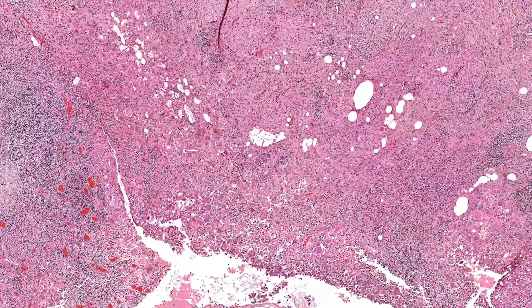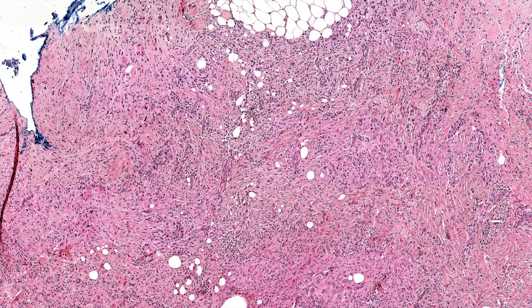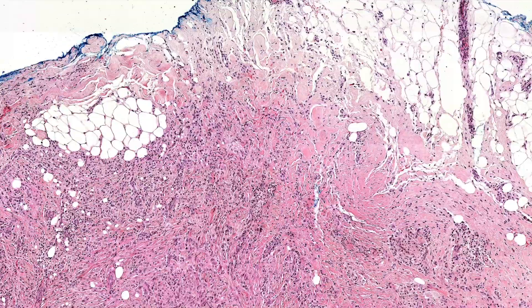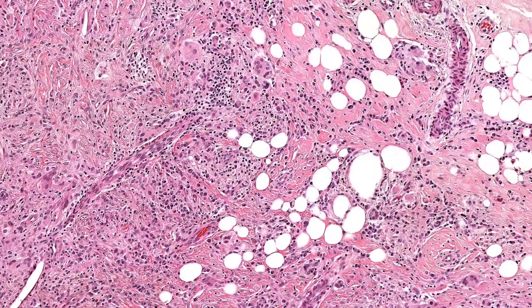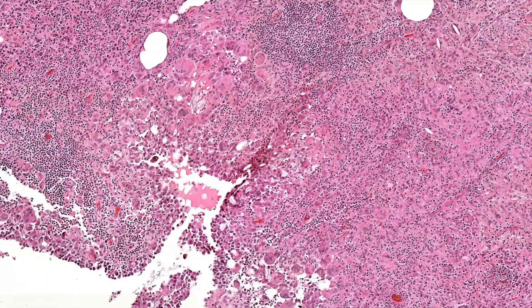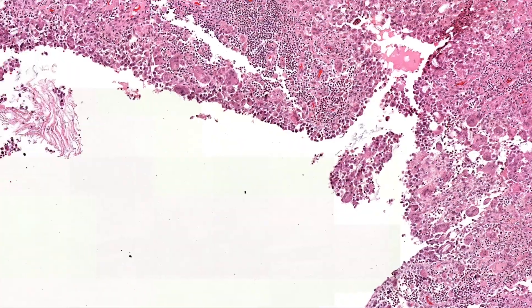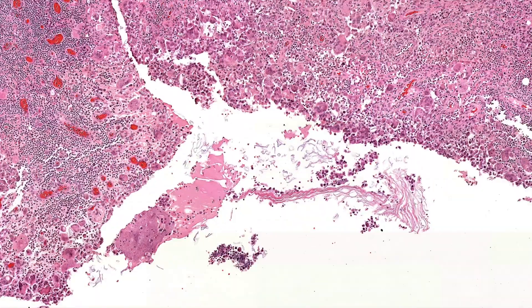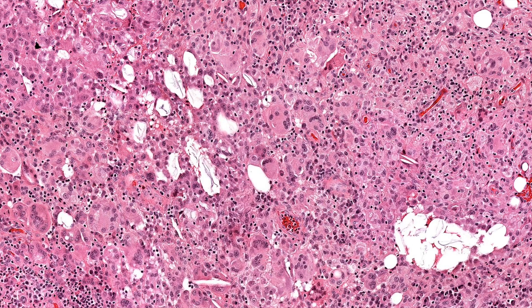It is actually an important thing to recognize because we see these regularly — they take it out as a cyst, we see it's a bunch of granulation tissue, fat necrosis, scar, and young granulation tissue. There's fat necrosis, more dense fibrosis, giant cells, lymphs, plasma cells, sometimes eosinophils and neutrophils. Then you get big nice granulomas, kind of palisaded around a big cystic space, and in the cystic space we've got keratin debris.